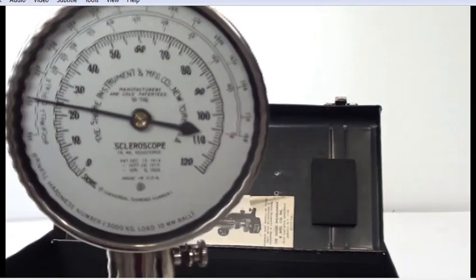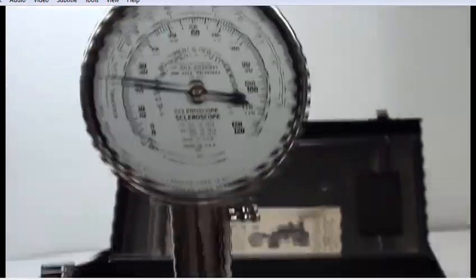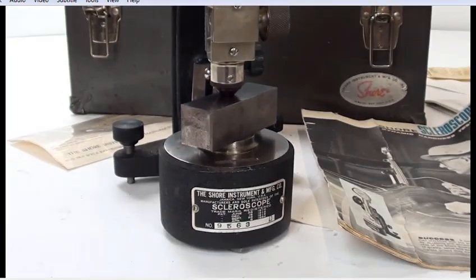And it comes in at 23. Not bad. Not bad for the first time. Exactly.